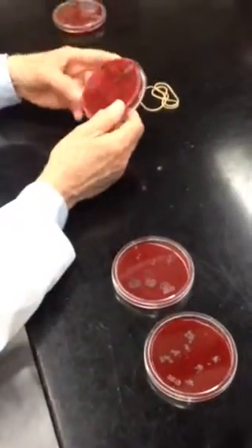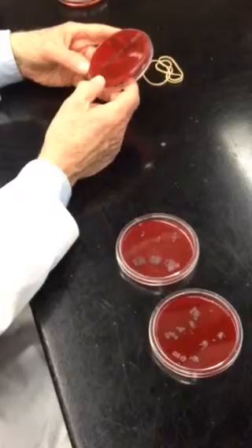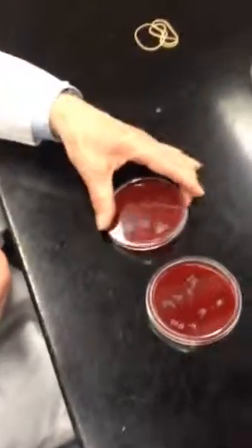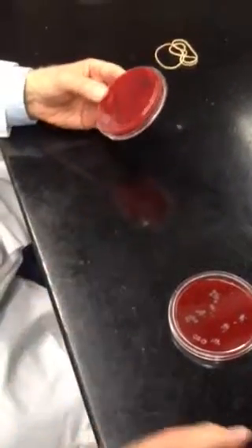This thing is marked 3 minutes, 5 minutes of what? Soap? No, that was the scrub. This was the scrub. Okay, I don't want that. I want, I don't know.